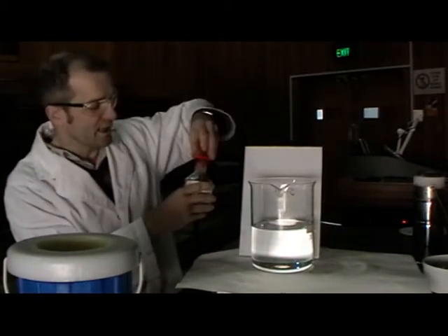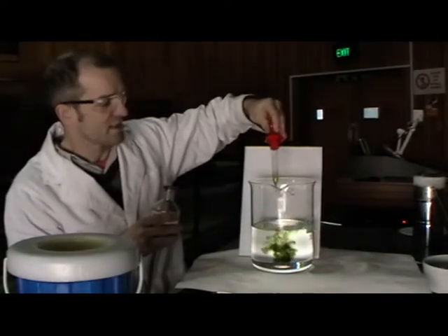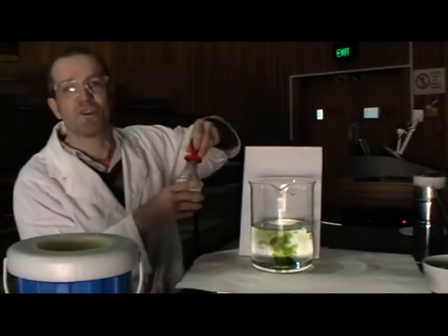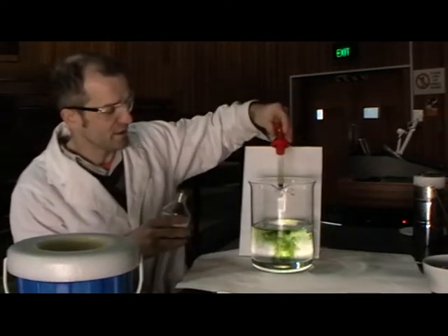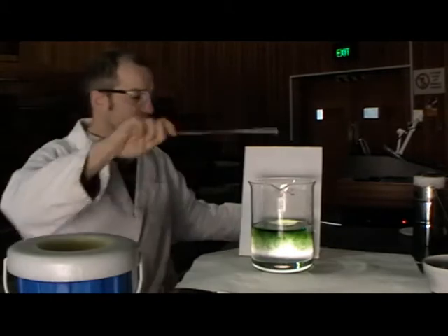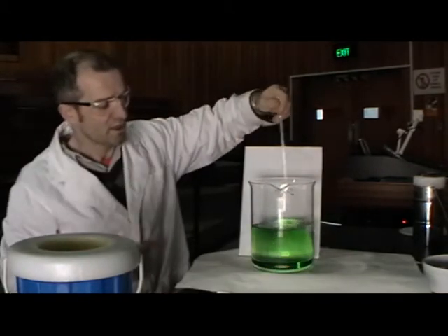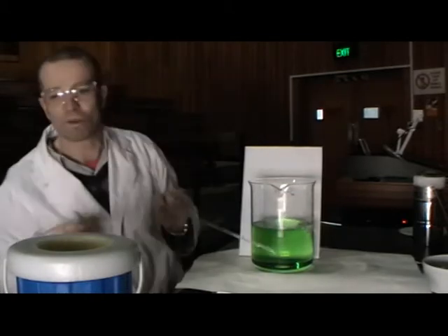I've got some water in my large beaker here, so I'm going to add some universal indicator. You can see it's a nice green color. It's just a neutral water solution. Let's give that a bit of a stir. We've got a nice neutral water solution.